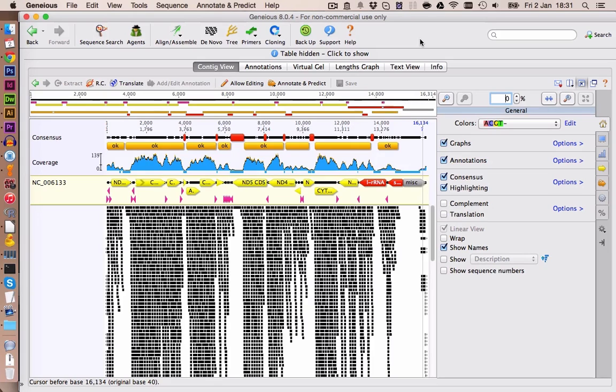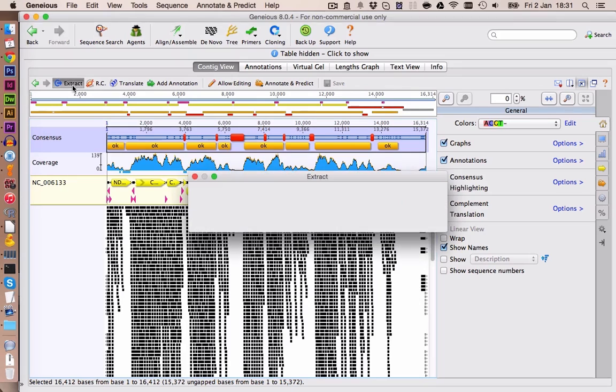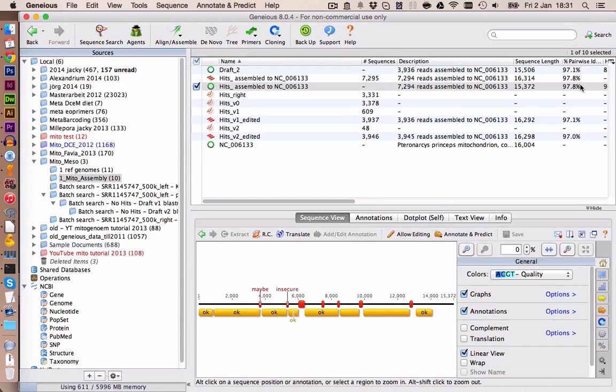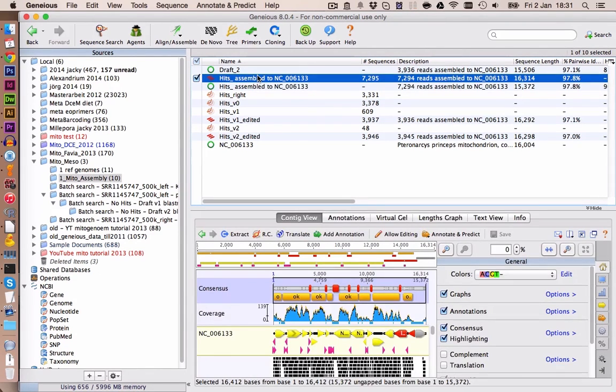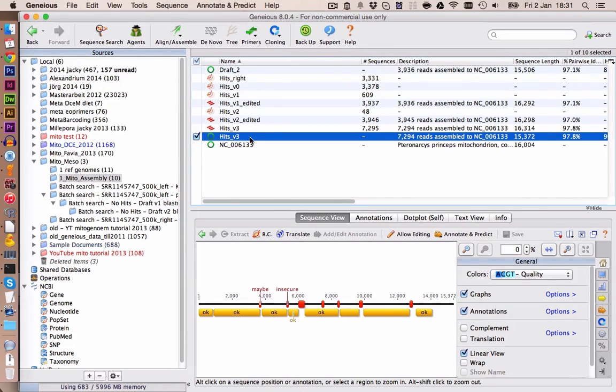Okay, I'm done adding the annotations, and we're going to select the consensus sequence and save this one as an extra file. Let's minimize everything again, and we should rename those two here to HITS version 3. I think it's a good idea to take some other reference genomes and make an alignment with our draft sequence to see if at least the protein encoding regions are making sort of sense, or if there are more errors in our sequence.